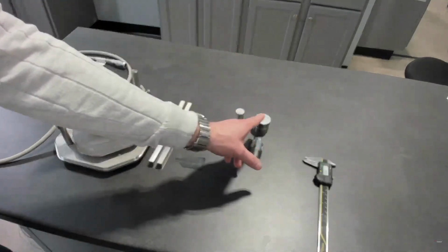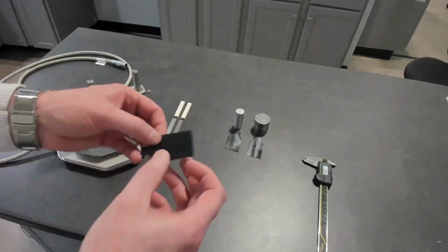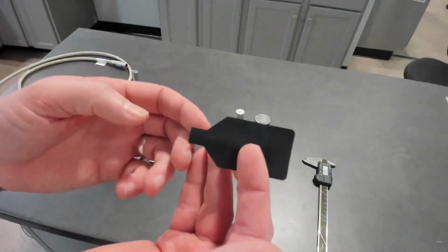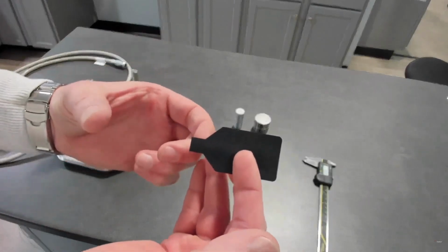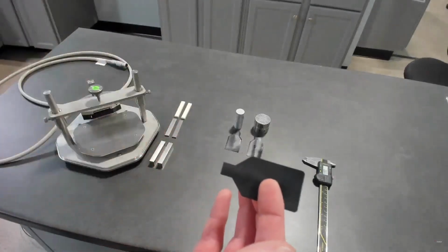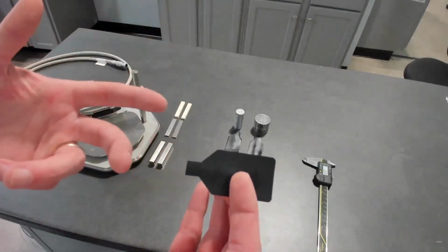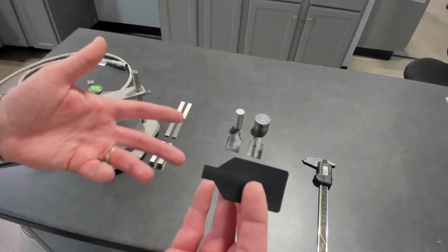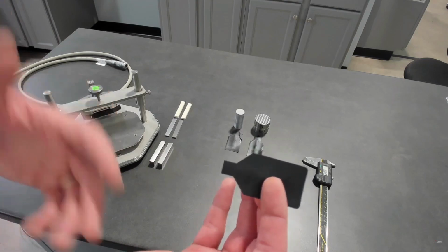This is for three-dimensional. Transient hot strip sensors are square or rectangular. This one is 10 by 10 millimeters. We have other sizes that are longer and wider, and they give you the ability to measure larger samples. The advantage of measuring larger is the sample's more natural in that dimension, or perhaps it's a little bit more heterogeneous, whatever it might be.